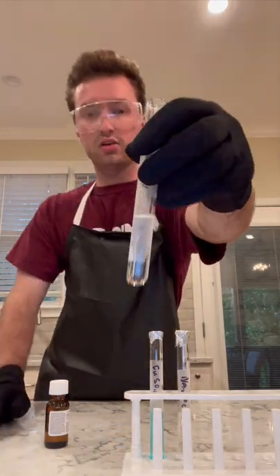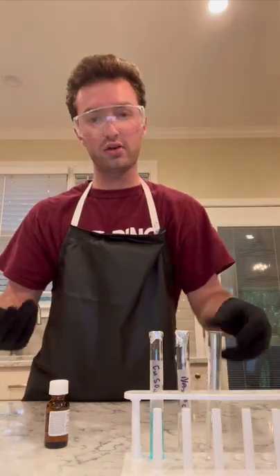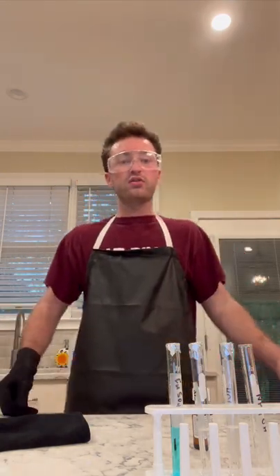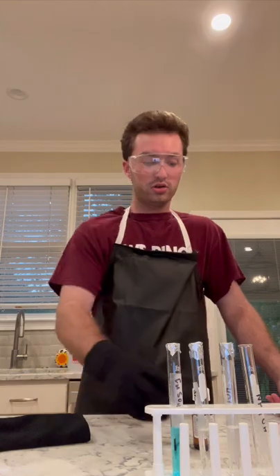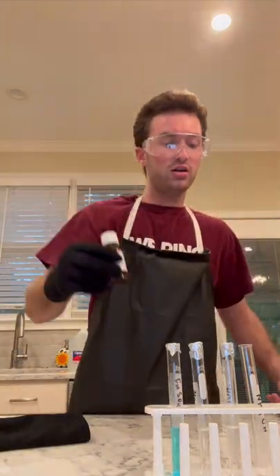Here we go, the dissolved hydrochloric acid and distilled water. Obviously with it being a liquid, you're not really going to see that much of a difference. But alright, now I'm back for the second part of my second reaction, which is preparing my 10.0 milliliters of 7.5 molarity NH4OH. As you can see right there, the ammonium hydroxide.